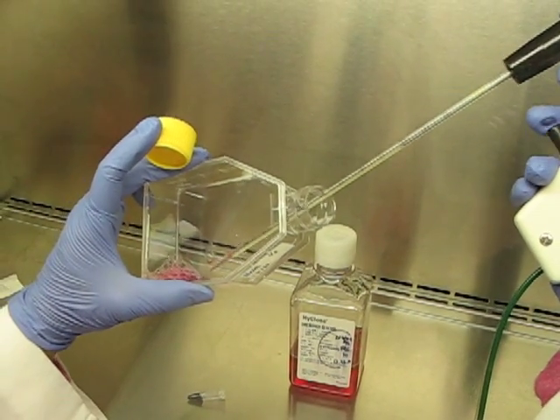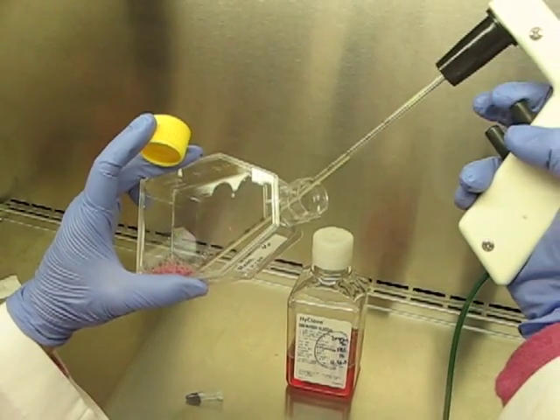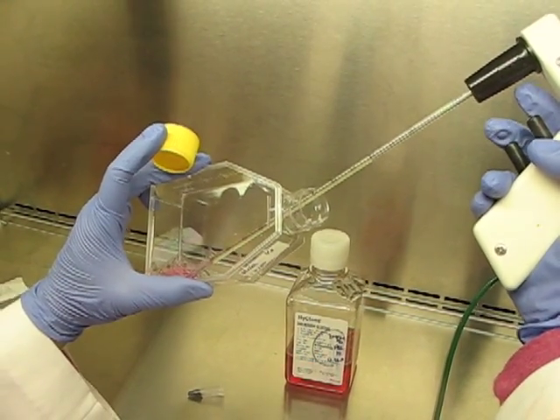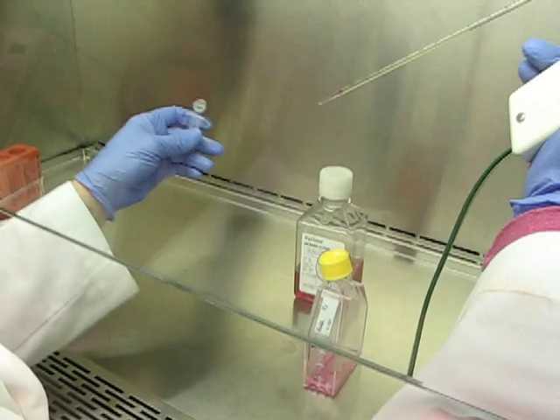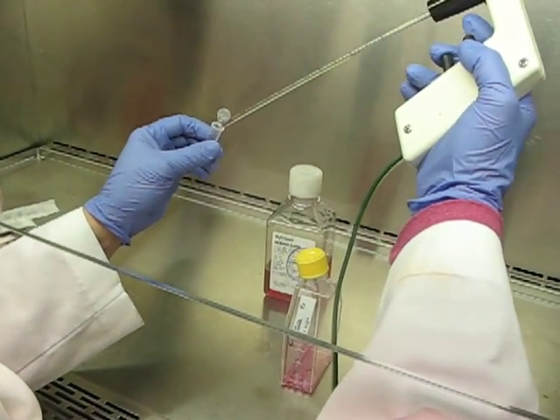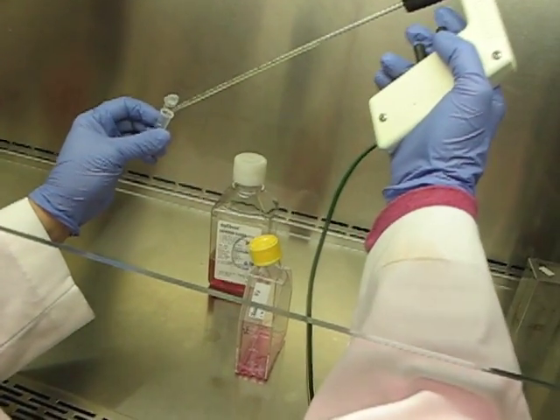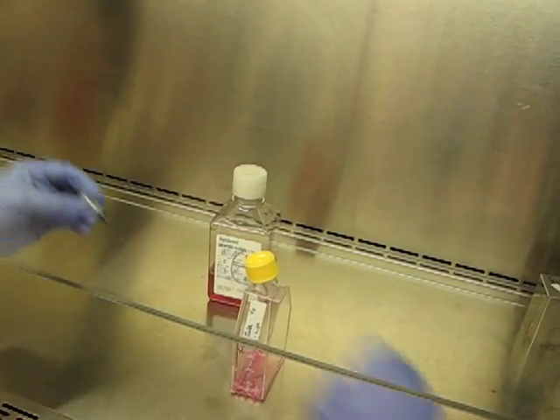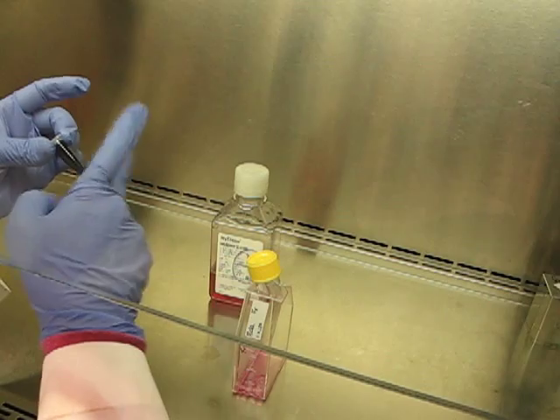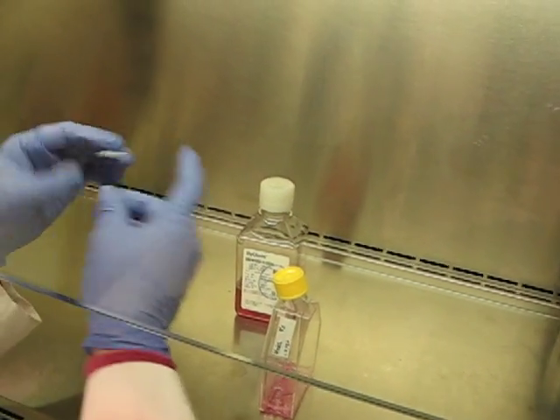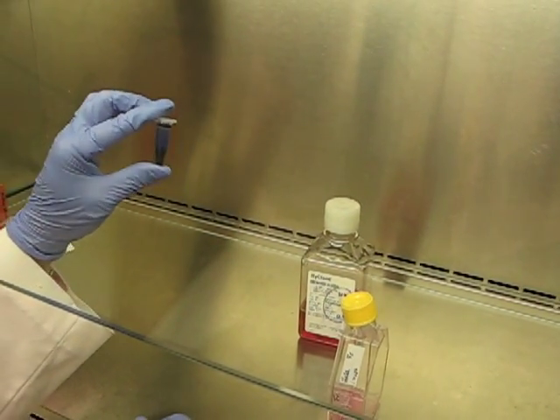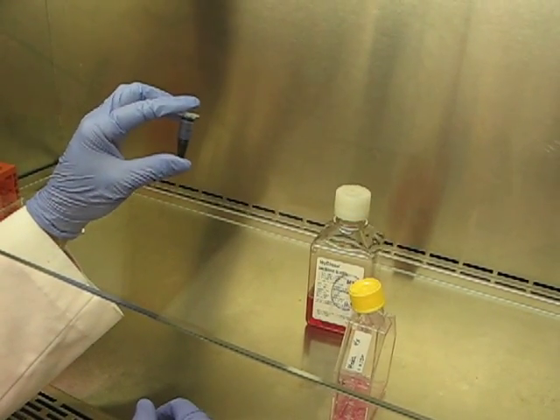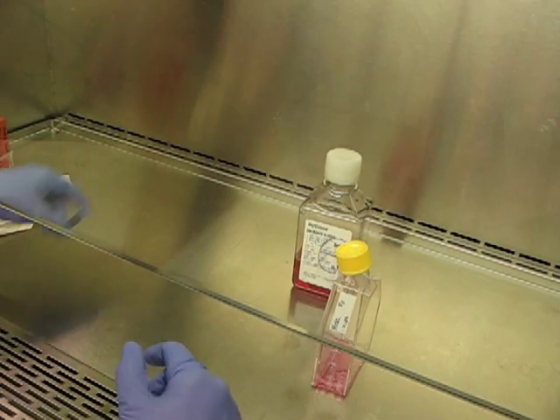Until you are at 100 microliters. Sometimes you got to do it a couple times until you hit it right. There we go. So I have my cell suspension that I want to count. I'm adding it to the trypan blue and I flick that to mix it. You need to incubate this for about five minutes in order for the non-viable cells to absorb the trypan blue dye, and so I just set it aside.